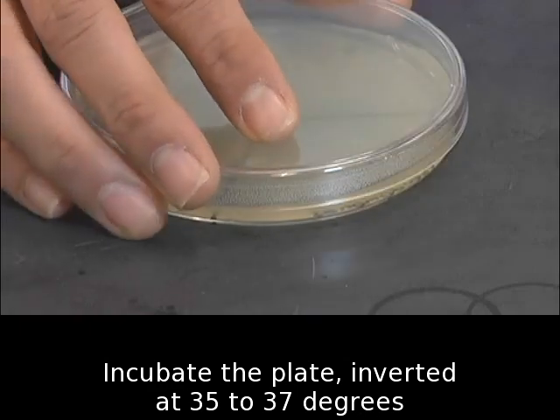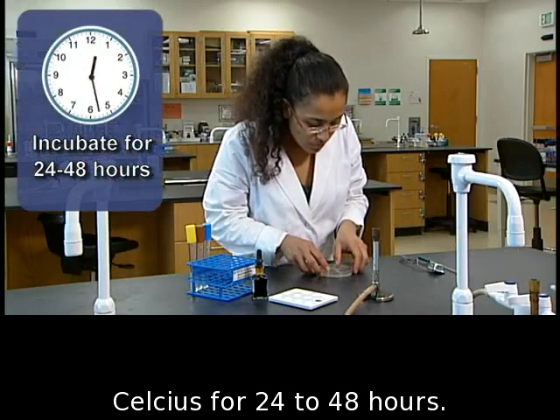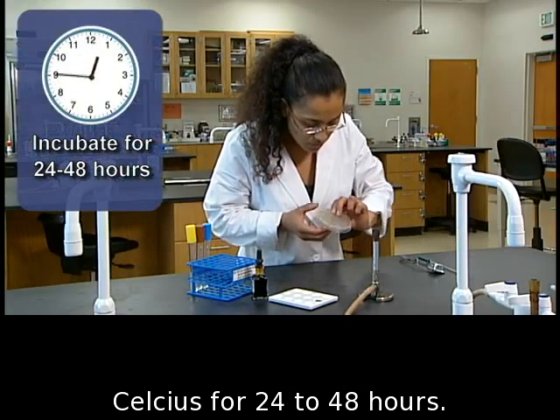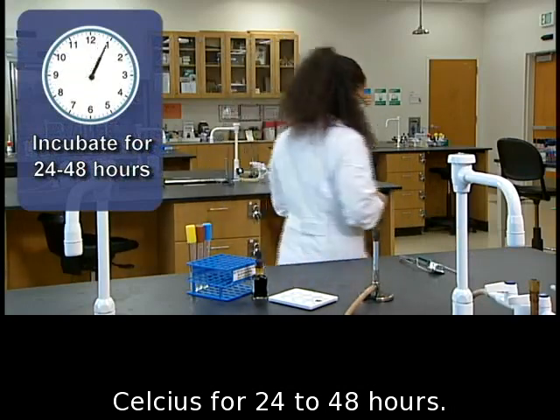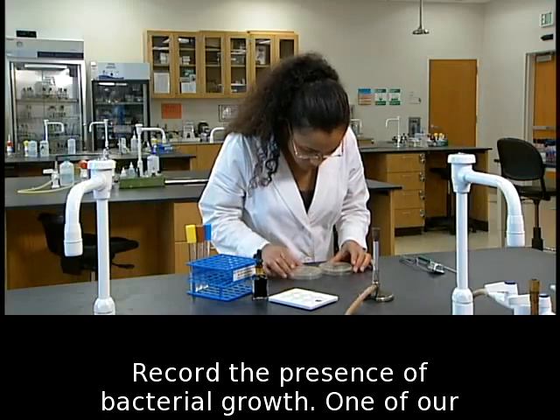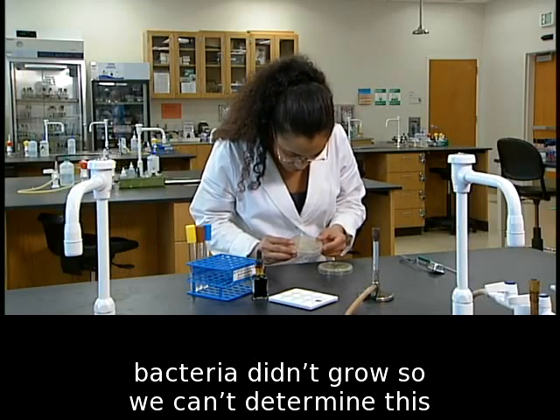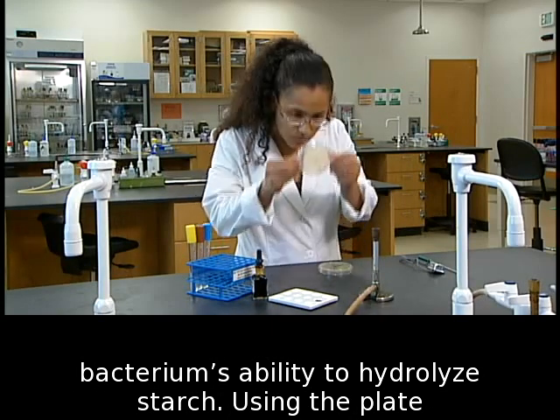Incubate the plate, inverted at 35 to 37 degrees Celsius for 24 to 48 hours. Record the presence of bacterial growth. One of our bacteria didn't grow, so we can't determine this bacterium's ability to hydrolyze starch.